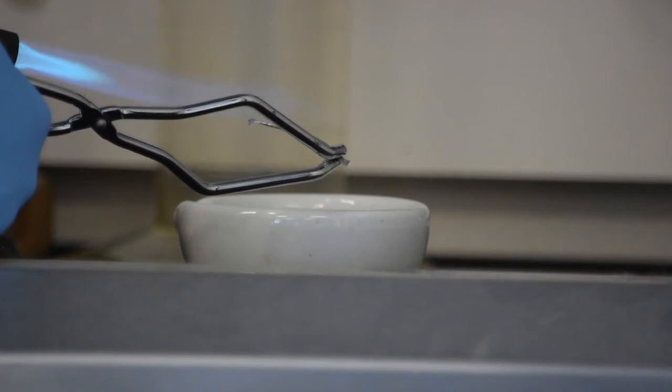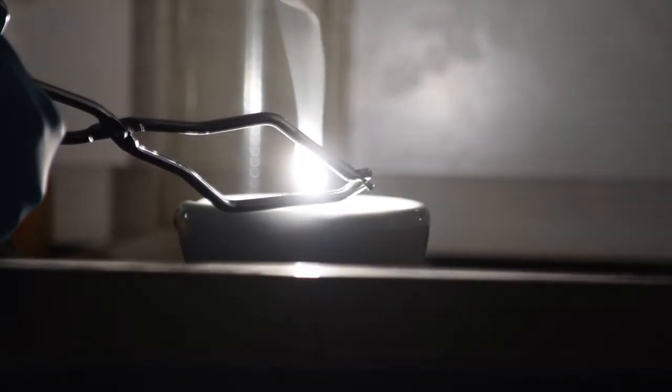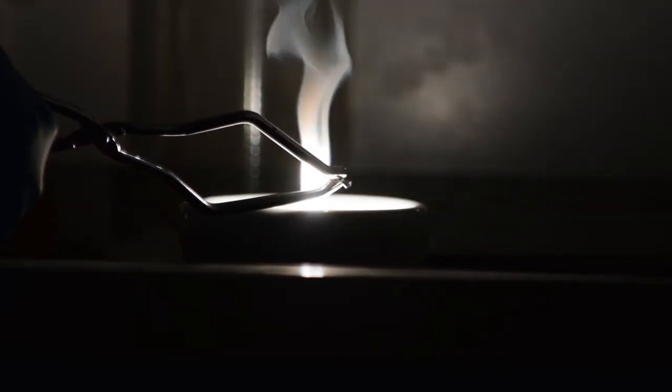If you look closely you can see that the magnesium ribbon is being held by the crucible tongs and we are adding heat to get this reaction to go. This is an extremely exothermic reaction which produces a bright light and lots of energy.